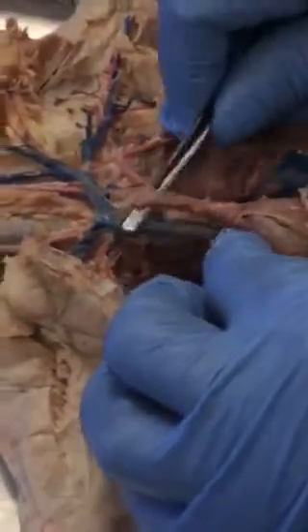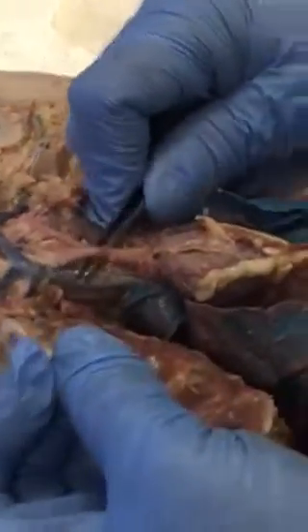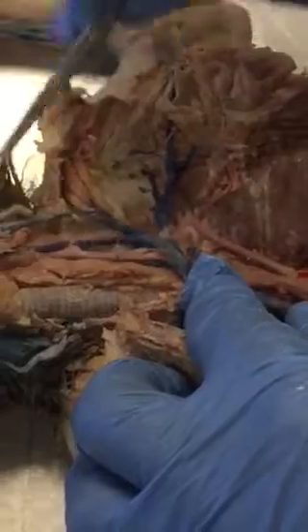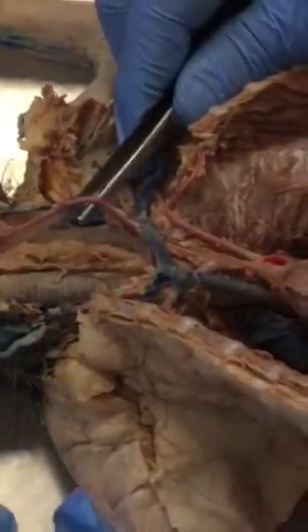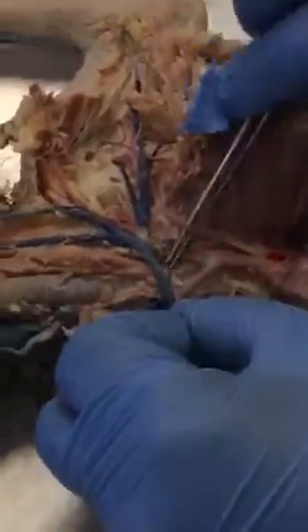All right, over on this side is your second branch. That's your brachiocephalic that we've been talking about. We saw that on the heart. What we didn't see are the three branches that we said come off it. So here they are. That's your first branch there, and it becomes your left common carotid. And then if you move this, you can see the second branch.